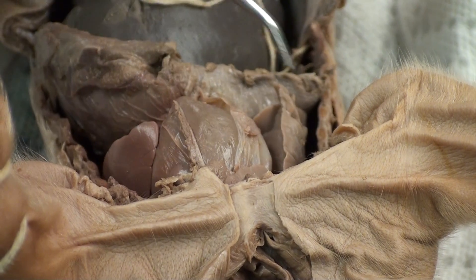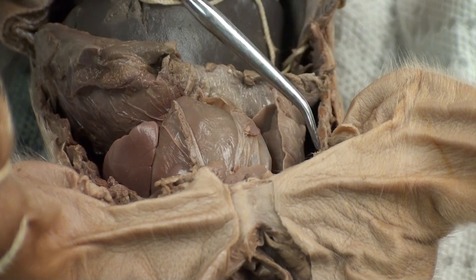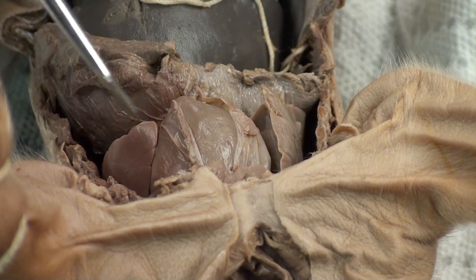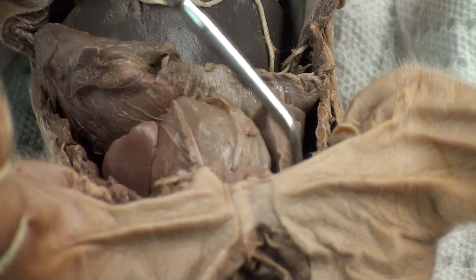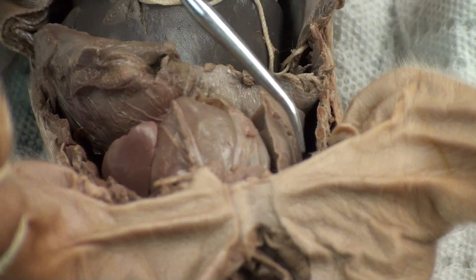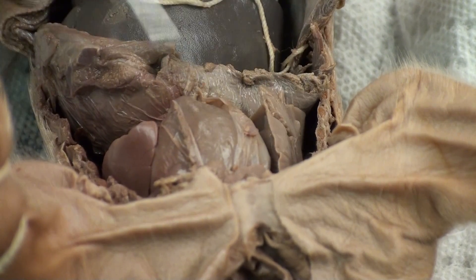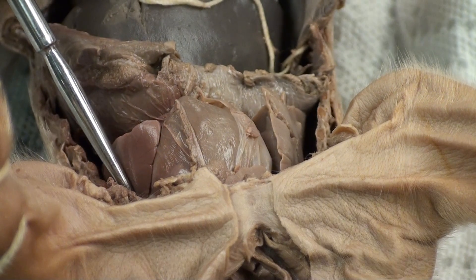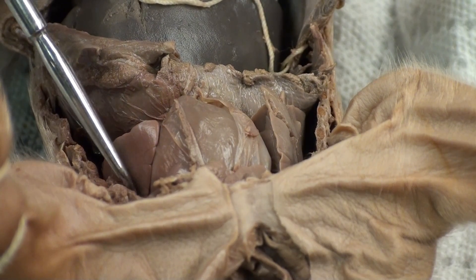These two rather large structures on the sides of the heart — this would be the right lung, and this right here is the left lung. These two are the lungs.